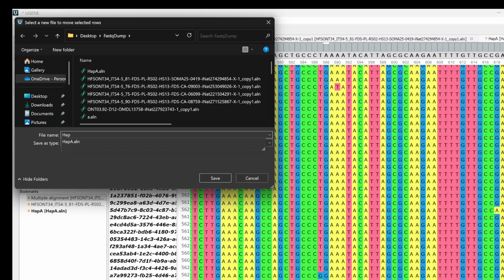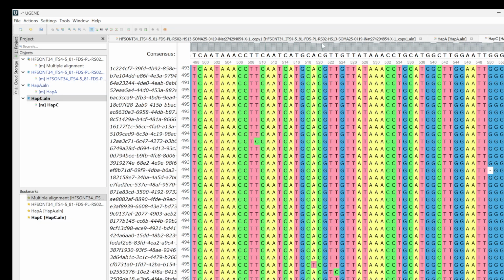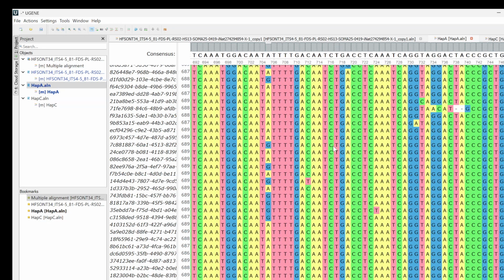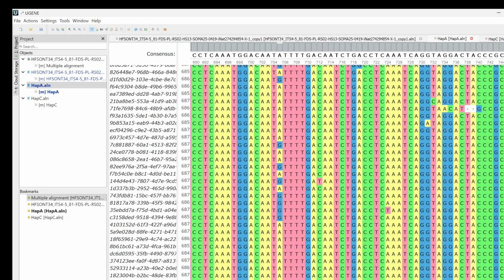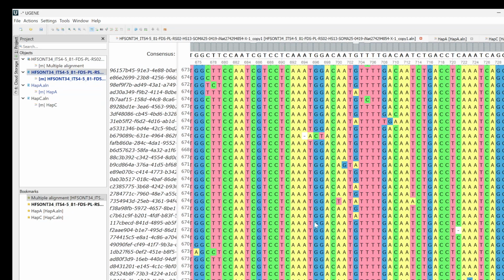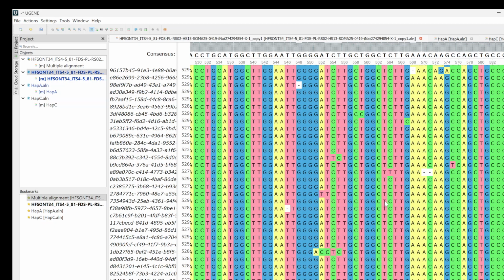And Hap C. Really, I should have named this one Hap B, and this should be Hap A, whatever. Okay, so here's our haplotype C. Even within that, there's a little background noise, but we'll just take it. Let's see what we have left here. Yeah, other than those columns of gaps, there's still a little bit of stuff happening there, but again, it's more or less now separated to relatively clean haplotype variants.